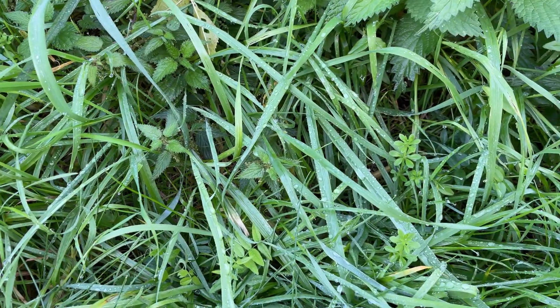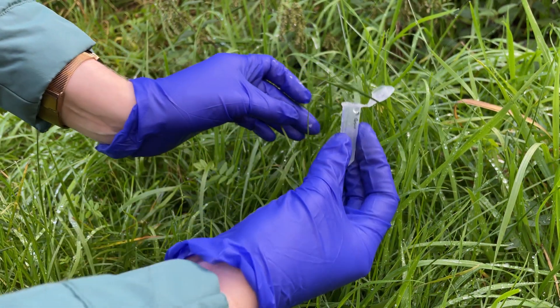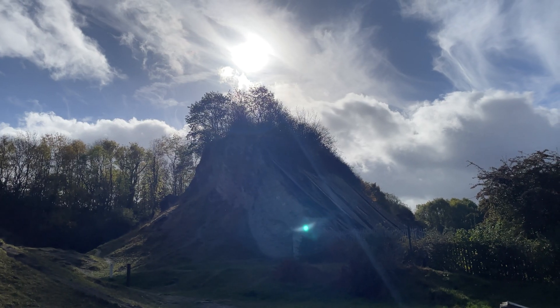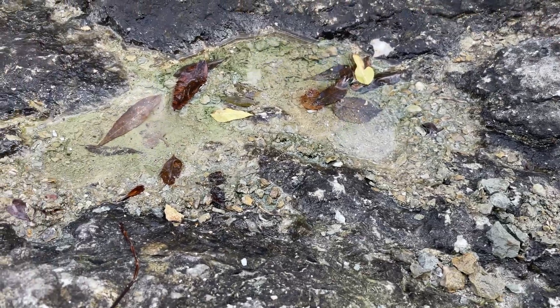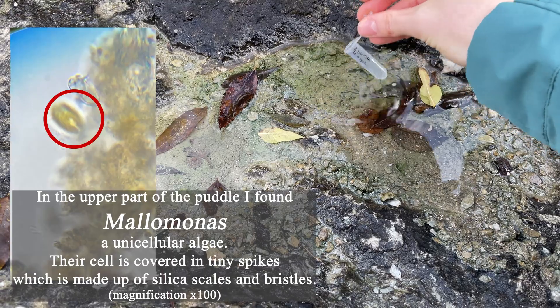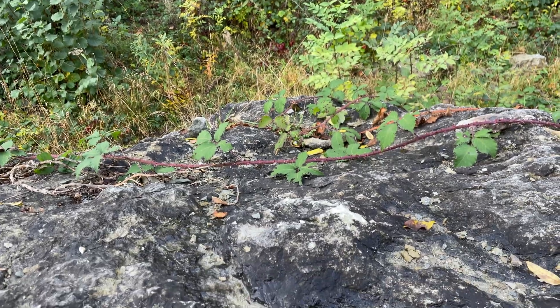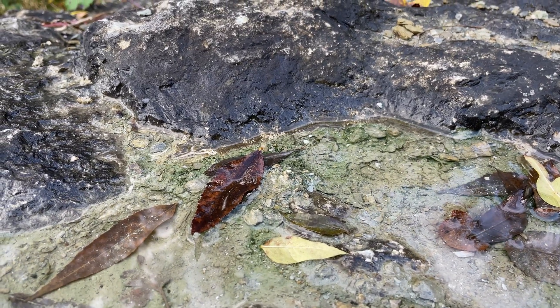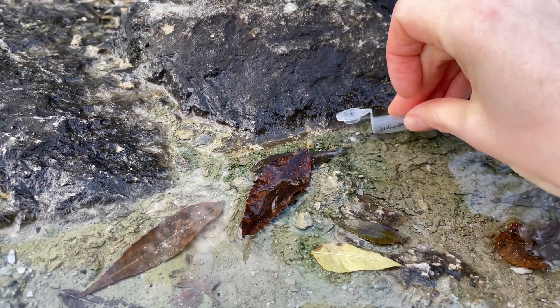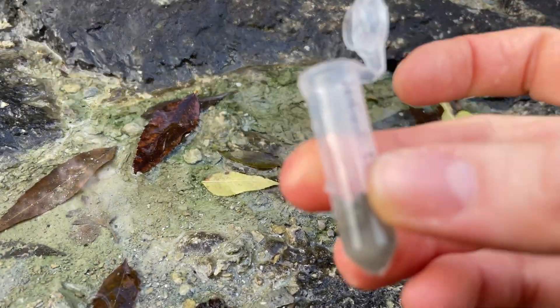Sample number five is morning dew. The last sample is a puddle in a rock, so let's get some. I can clearly see that on the bottom of the puddle there are some kinds of algae, so I want to check out what's in the benthos of the puddle. We've got plankton of the puddle and this is the benthos of this puddle.